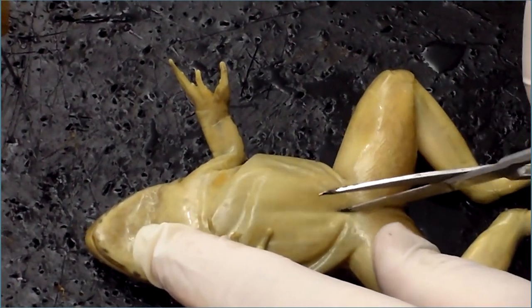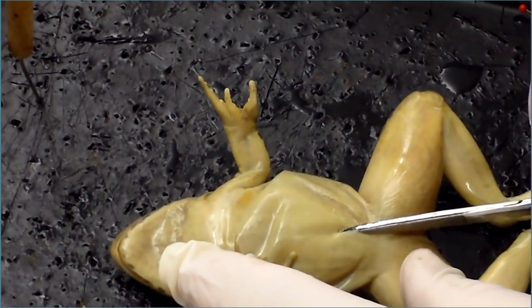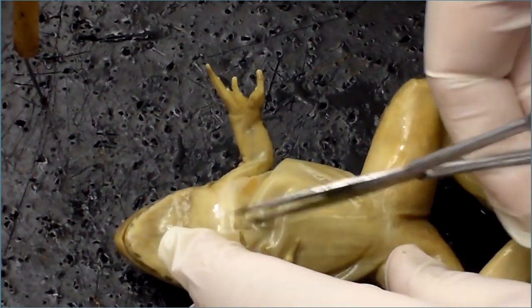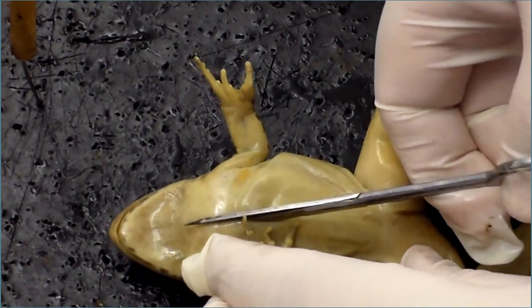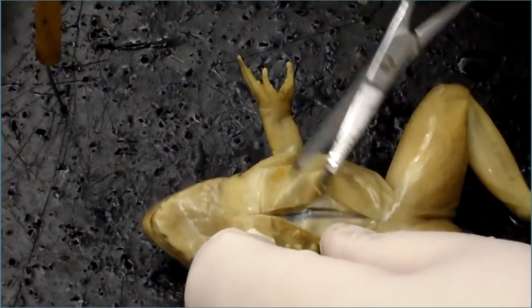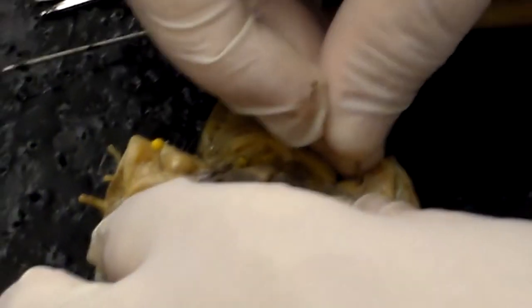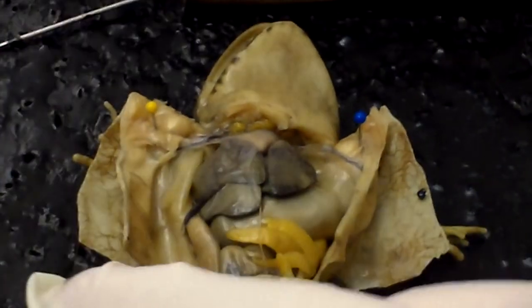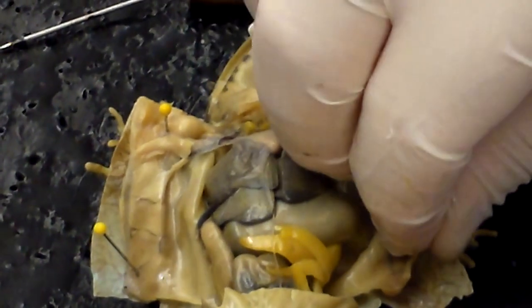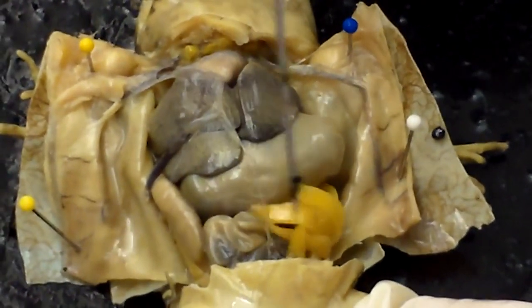Now, as we have discussed the structure of frog and human, we are going to show you the dissection of a frog in a real-life video, following the same procedure as studied earlier in the virtual dissection. With the help of scissors, cut through the skin of the frog so we can study the internal organs. We are now able to identify and study the internal structure of the frog. We can see the liver, gallbladder, stomach, intestine, large intestine, spleen, heart, and lungs.